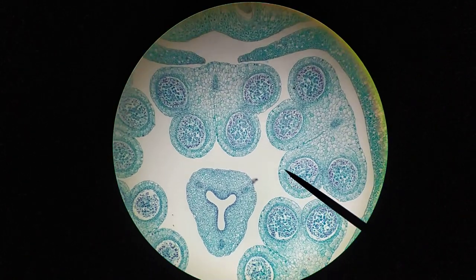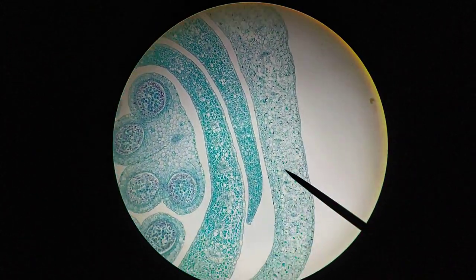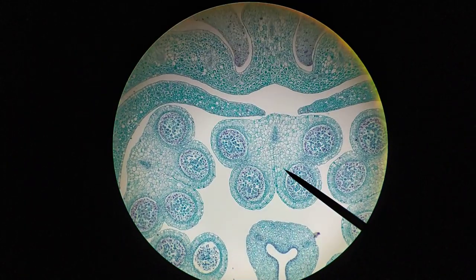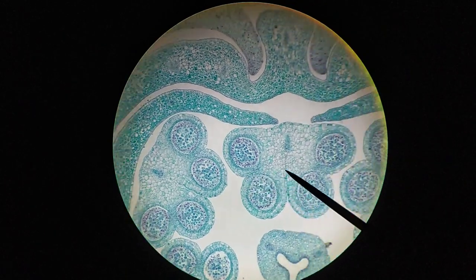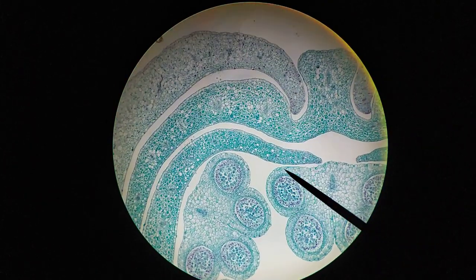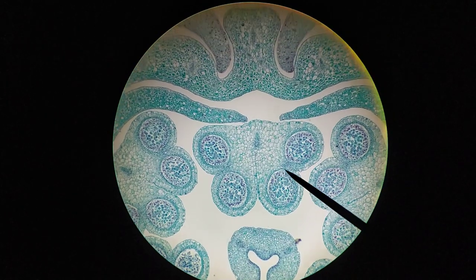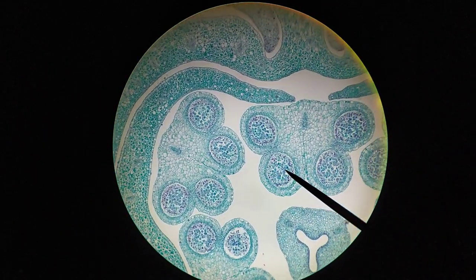What you're looking at right now is a cross-section through a flower bud. Out here you have the petals on the outside of the flower bud. You can see the petals in cross-section, and on the inside you have these structures. Around the outside you have anthers — this is where we're going to be looking for meiosis. This structure I'm outlining is an anther, and within the anther you have four chambers called locules: one, two, three, and four.